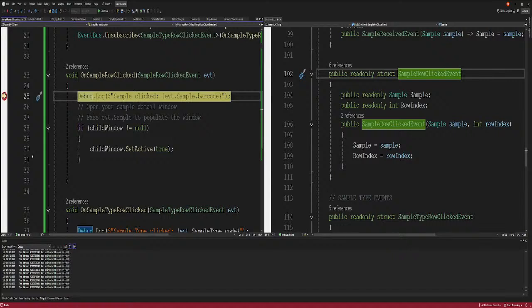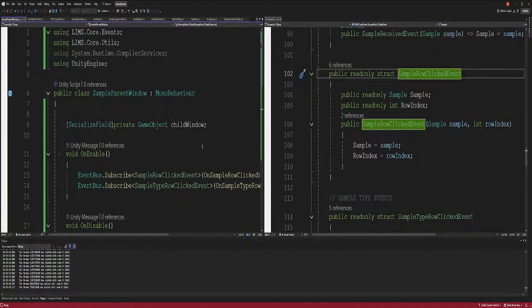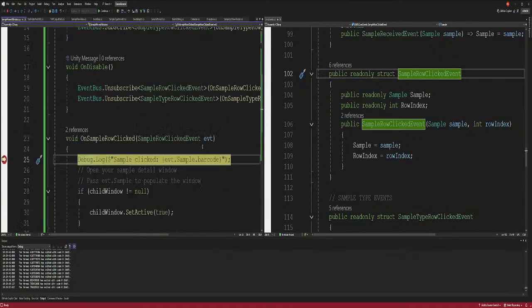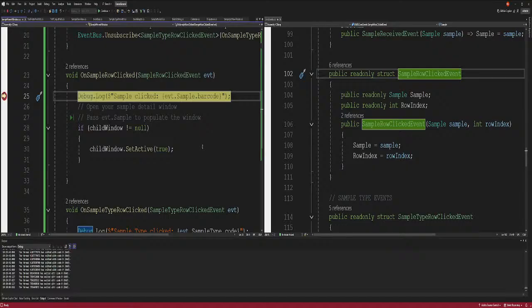It is receiving, well, it's attempting, no. Sample is null. Why is sample null when we specifically, okay, so sample parent, except on row clicked. Oh, okay, so I got that wrong. Oh, why did I do that? Oh, no, row click, sample click, sample data. No, that doesn't belong here. I'm sorry, folks. All right, so who's actually the, okay. I get it, I get it. I'm sorry, my fault. Sample row data.